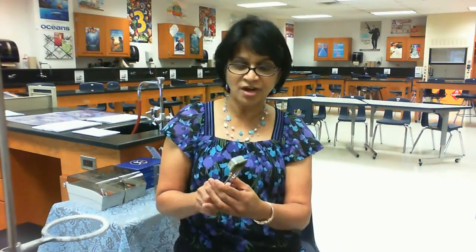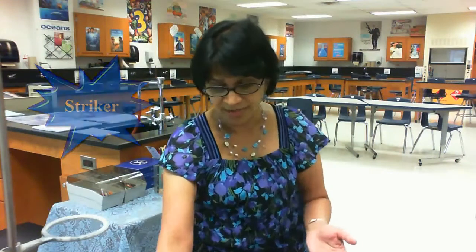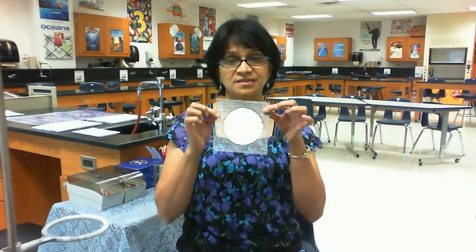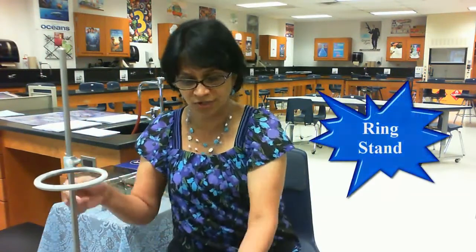Alright, we talked about the burner and flame. How are we going to light the burner? This is the striker, and we use the striker for lighting the burner. This is a wire gauze which helps the flame to spread, and I'm going to show you the stand. This is a stand on which we have a ring stand, and on top of the ring stand we keep the wire gauze, and the wire gauze helps the flame to spread all over, so we get the substance heated evenly.